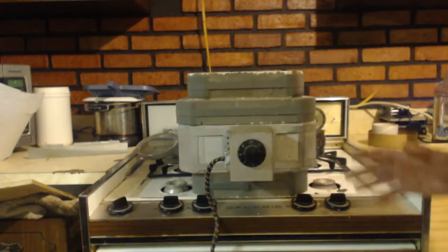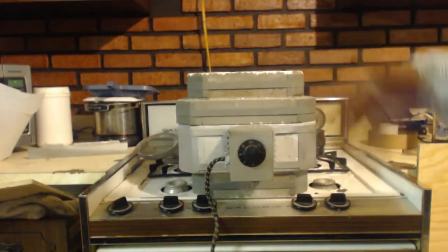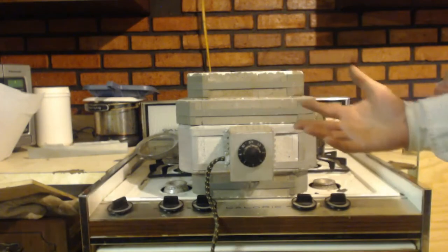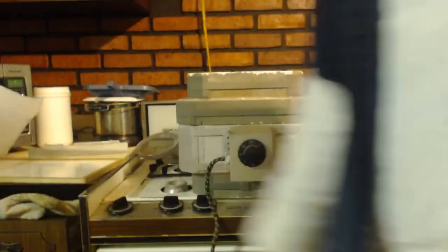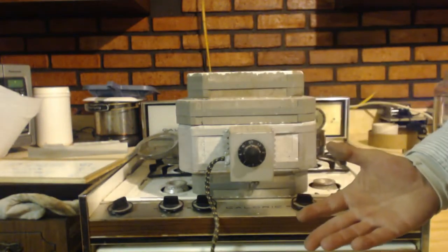Okay, that did work, but it's taken so long. I mean, I'm putting this thing over the flames for 10-15 minutes just to get a couple grams off, and I got to go from 71 grams down to 40 grams. Right now I'm at 59, so it did go from 71 down to 59.